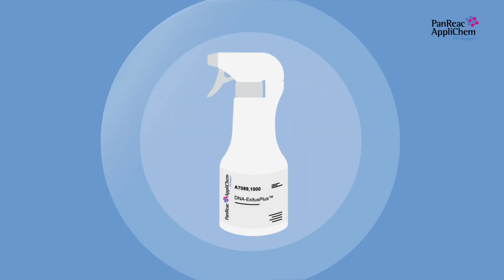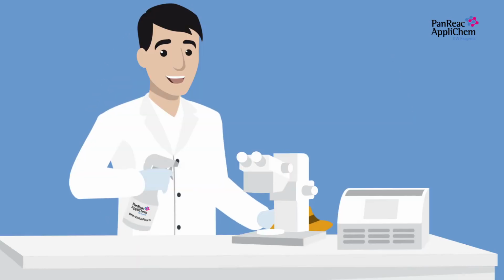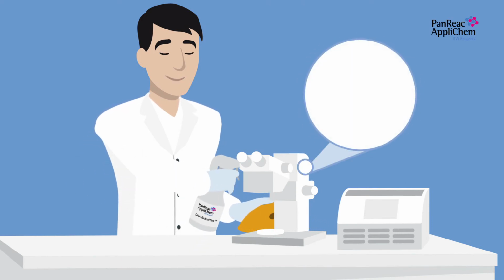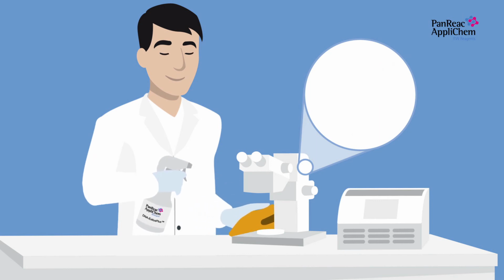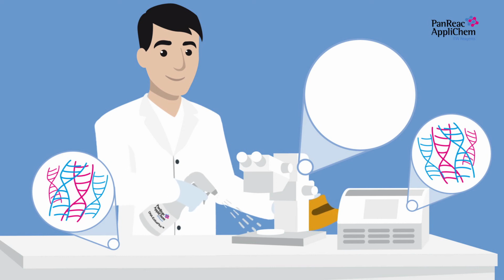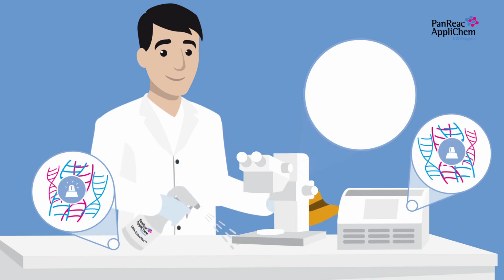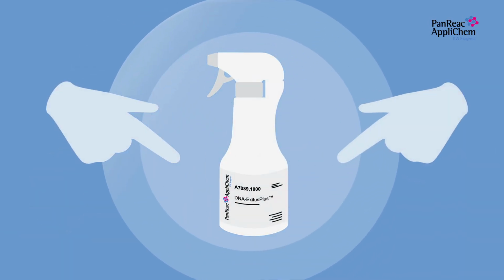Luckily, he found DNA-Exitus Plus to solve his problem and make his lab work much easier. It destroys free DNA and RNA completely, but in a smooth and user-friendly way. The usage is simple. Just spray DNA-Exitus Plus on all contaminated surfaces or lab equipment. Wait some minutes, finished.